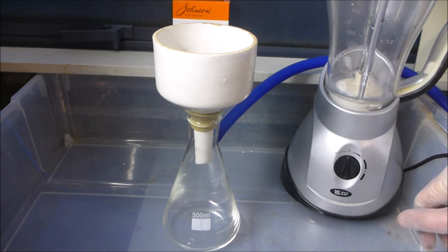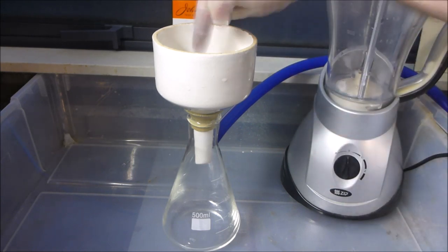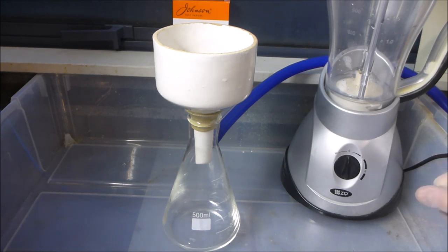Which is pretty frustrating. Now obviously the objective of filtering is to get the smallest particles trapped in your filter, but also to have as much of the liquid go through as quickly as possible. So I've come up with a solution that seems to work relatively well, and I'll just share that with you guys now in case you ever run into this problem. This is based on what I've seen around.